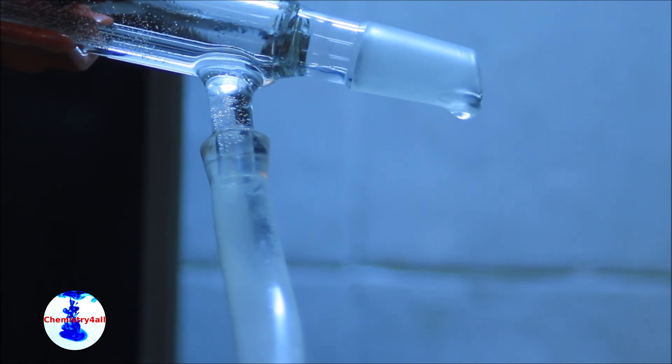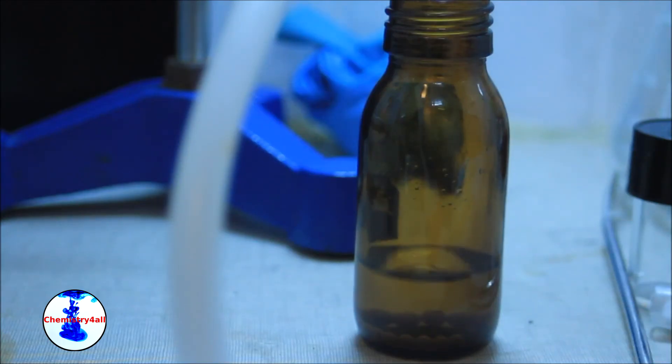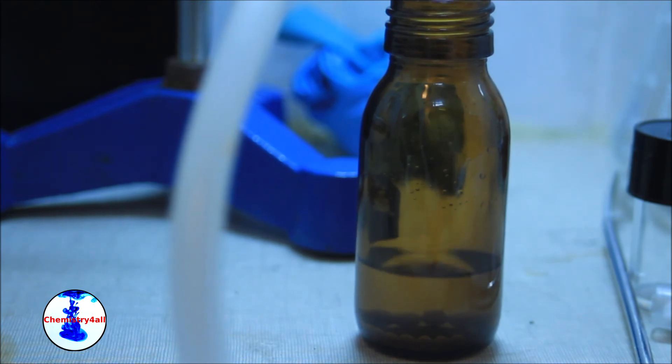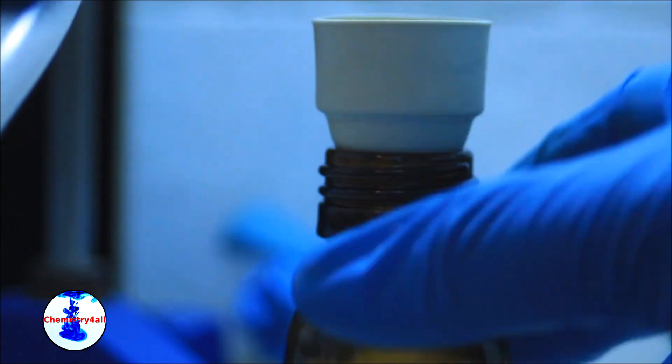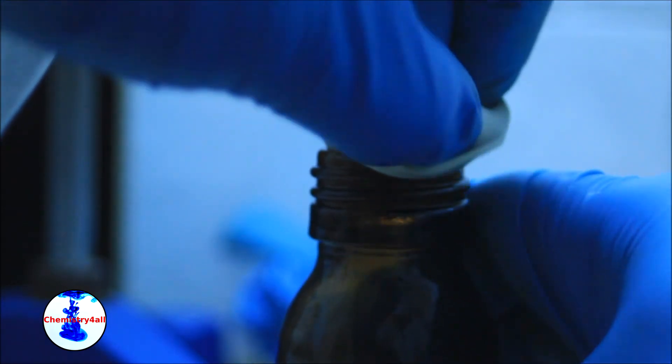The anhydrous ethanol is finally collected in a clean and dry vial containing some molecular sieves. The system is finally flushed with argon as explained before.